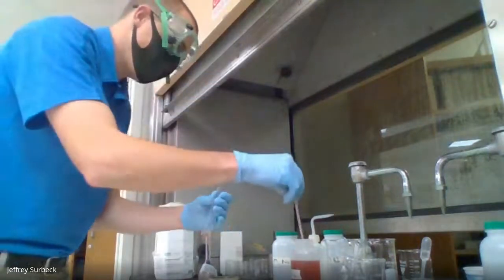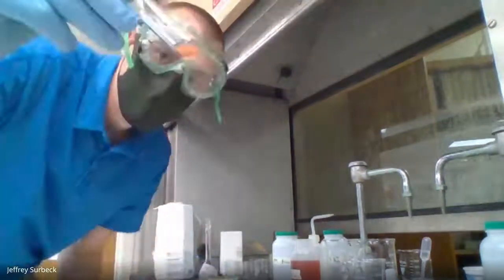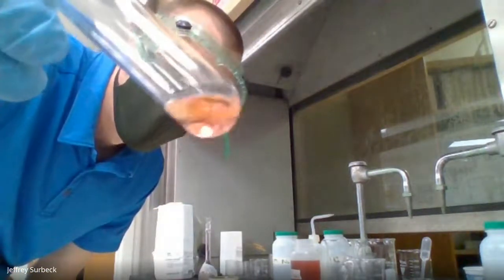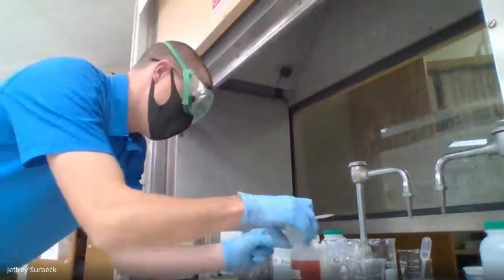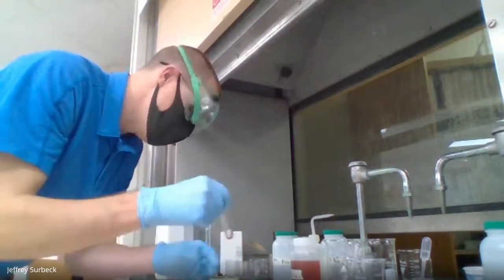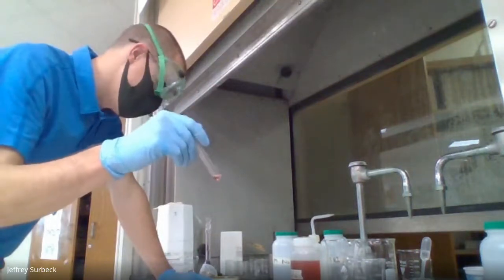Okay, so we have cobalt chloride here. It is this color, a pretty distinguishable color. It's this nice red-orange color that we have here with cobalt chloride. So what I'm going to do is take 12 molar HCl and place it into the test tube until we get a distinct color change.